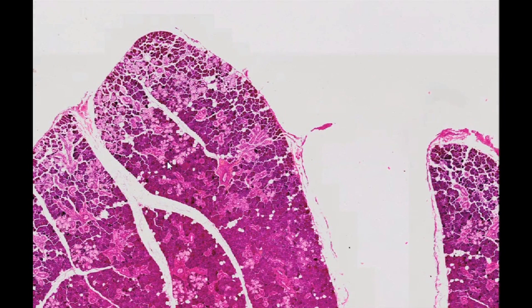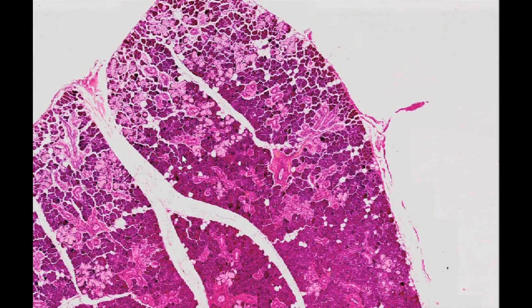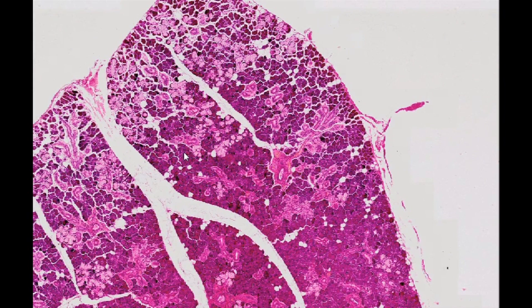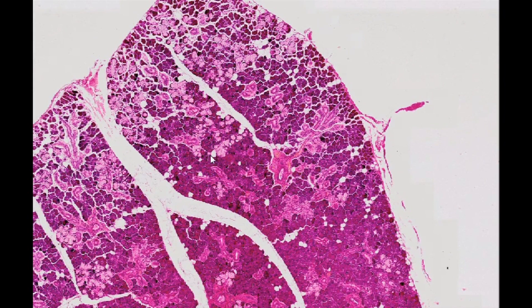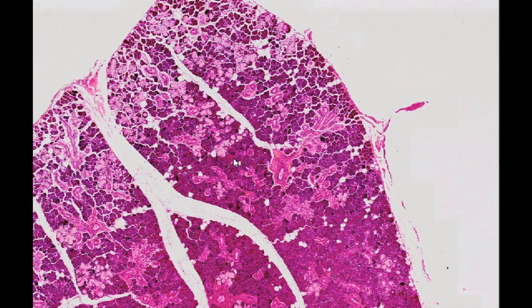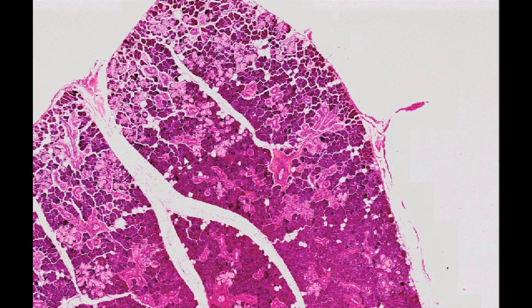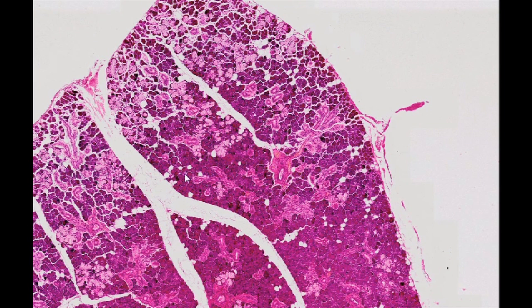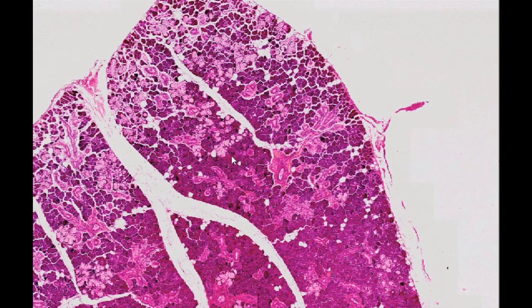Submandibular Gland H&E Staining. The submandibular gland consists of both mucus and serous secretory components, with the latter accounting for about 90% of the gland.